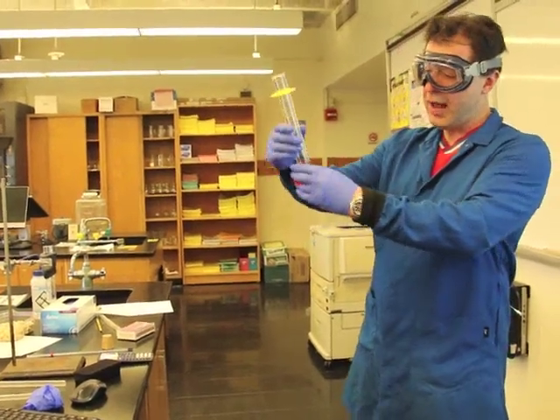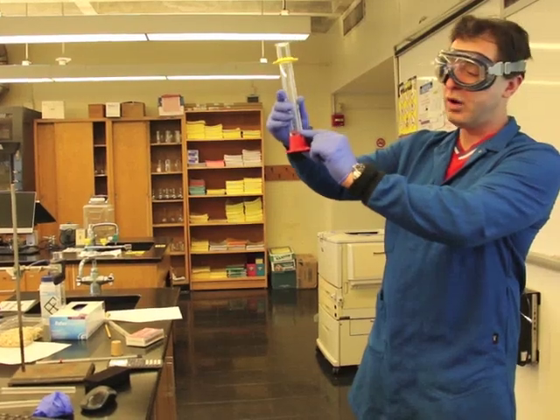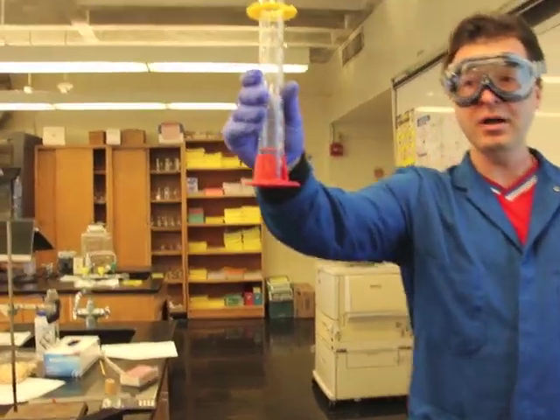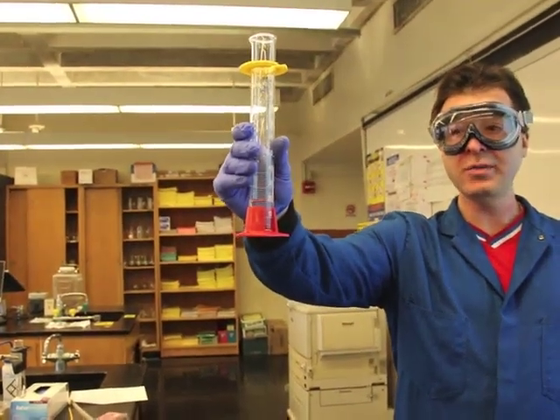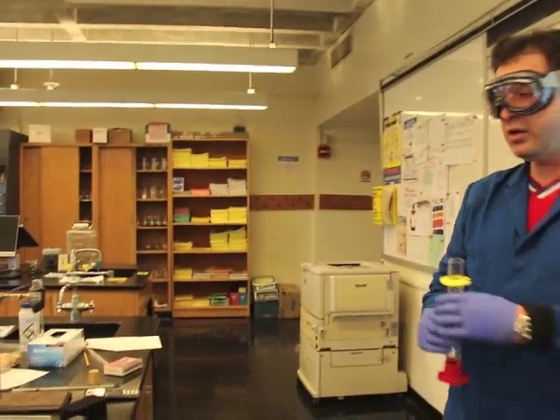Now I got my 20.0 ml of water. The way I did it is just add distilled water in here and the bottom of the meniscus is touching the line. Remember we learned in experiment number one with density that's the way to measure water in the graduated cylinder.